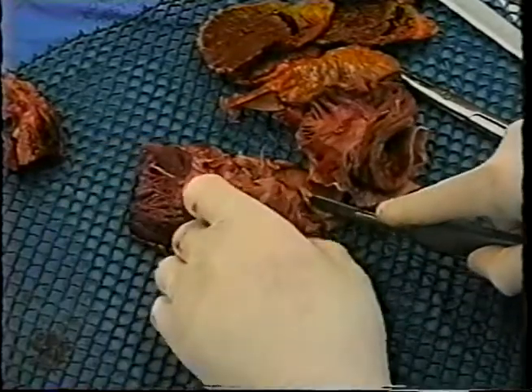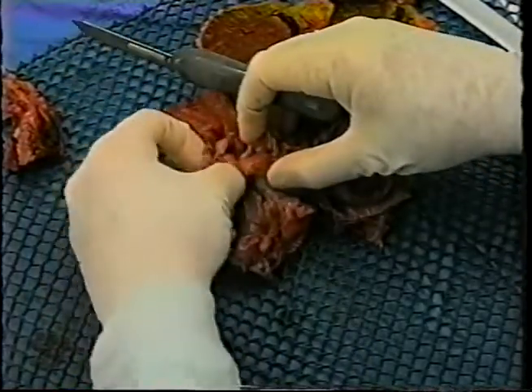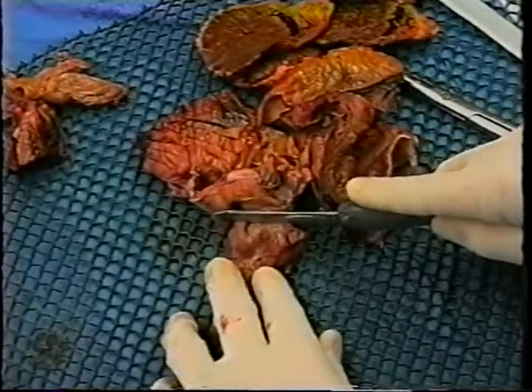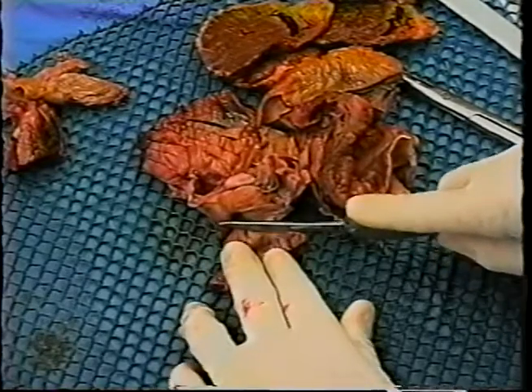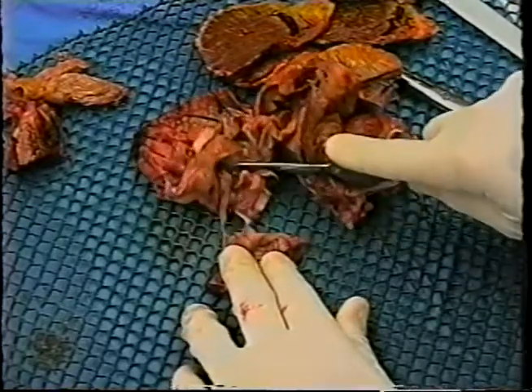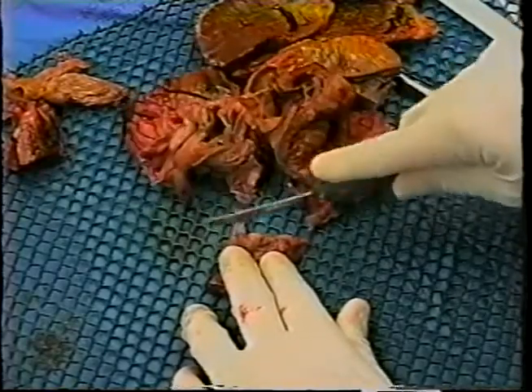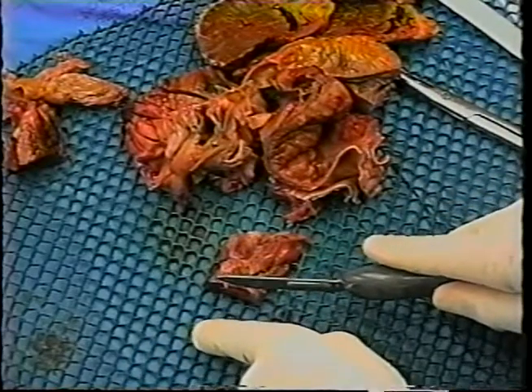And the final cut is made with the nearly excised rectangle of tissue. The final cut is made extending about 1.5 centimeters above the tricuspid valve ring. Some individuals, if they wish to study more of the right bundle branch, will take an additional block of tissue beneath this one for 1.5 centimeters or 2 centimeters.